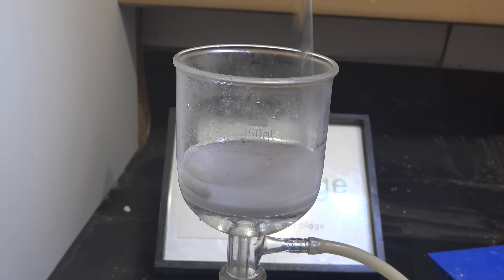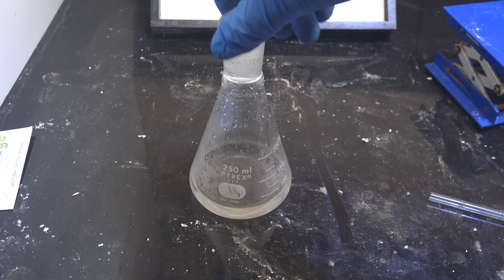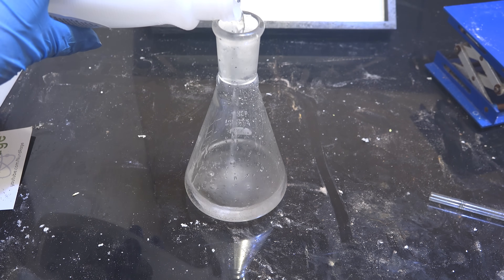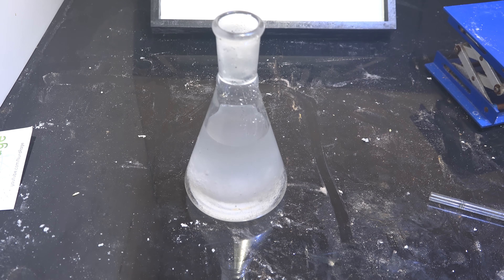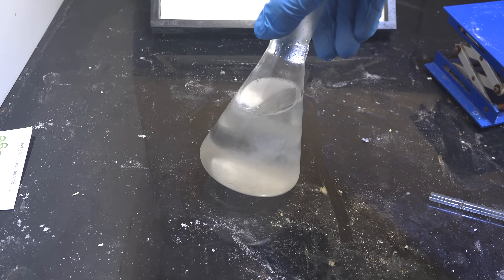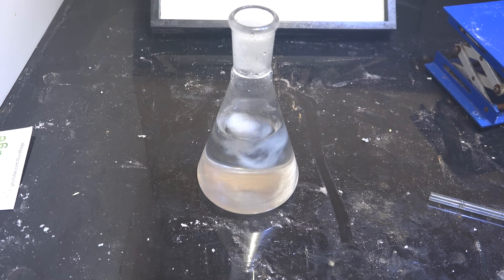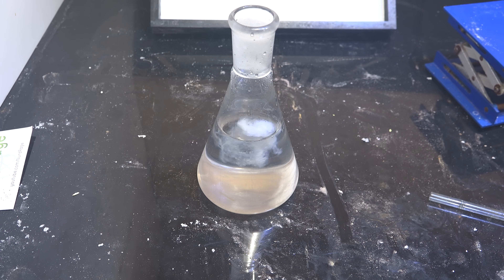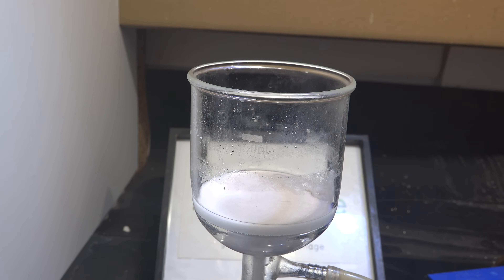Today is a very humid day in my lab so the hydrochloric acid is misting up like this. Once everything is dissolved, turn on the vacuum and filter the solution through. Now we have our solution of guanidine chloride. I want to precipitate it back out with more acetone, but it turns out it's extremely soluble even in a mixture of acetone and water. Nonetheless, the acetone does help remove more of the additives because some of them will congeal into a type of slime, as seen here. I'm not exactly certain which additive it is, but whatever it is I don't want it in my guanidine chloride, so we filter it back out again to get our purified solution.